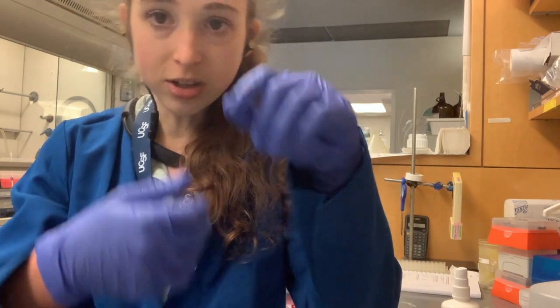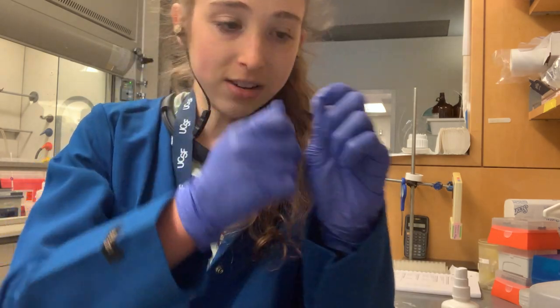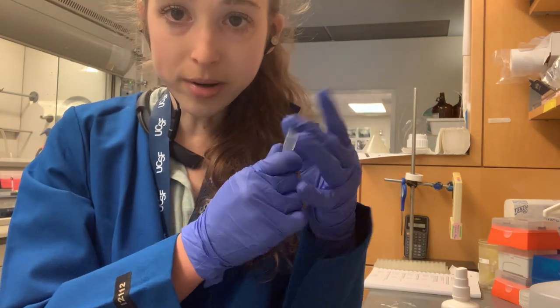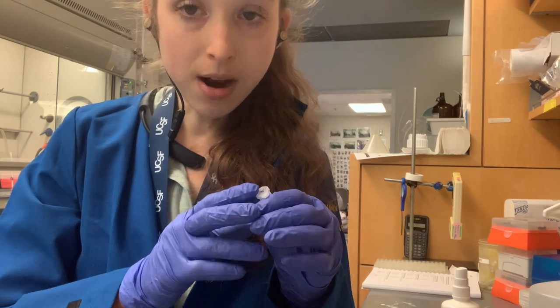Because what's going to happen is you stick your enzyme in, and now you're labeling the top and side of the tube with this fragile little protein inside that's supposed to be kept on ice. You're up here holding it, warming it all up and making it unhappy. If you label your tubes first, that's going to prevent this problem.